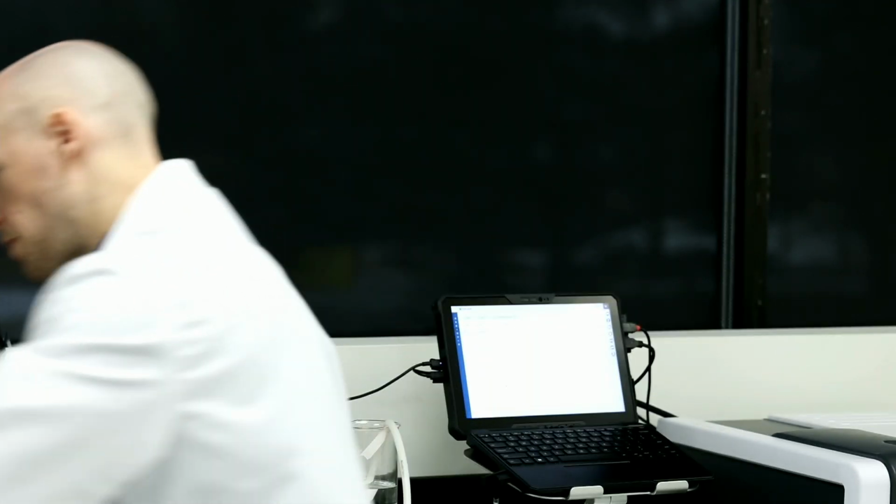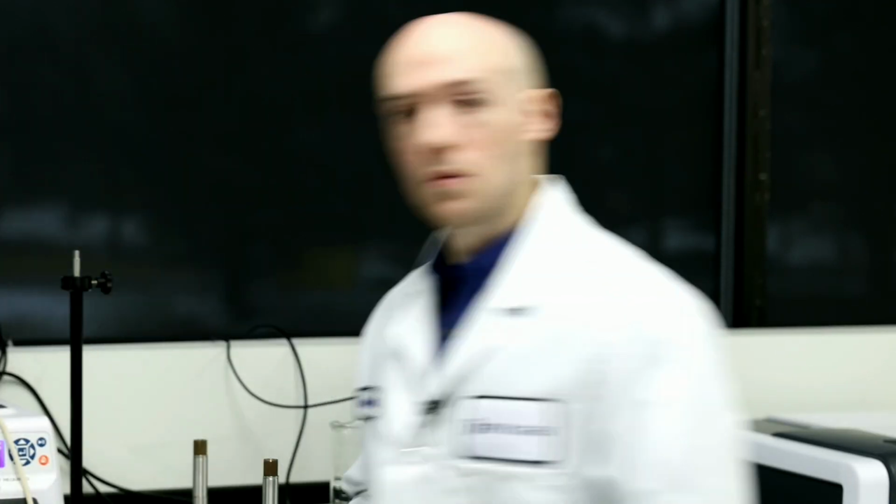Thank you, James. Great, thanks, Brandon. Next question I have here is, can I use the FlowVPX in single pass TFF or inline diafiltration processes for continuous manufacturing? Yeah, so I actually have a few customers that use the FlowVPX for single pass or say continuous chromatography. Again, you would either just put it before or after the single pass membrane if you want to know the concentration going into the membrane, or if you want to know the concentration coming out of the process. You can use that to help control the process, which is quite a nice tool.